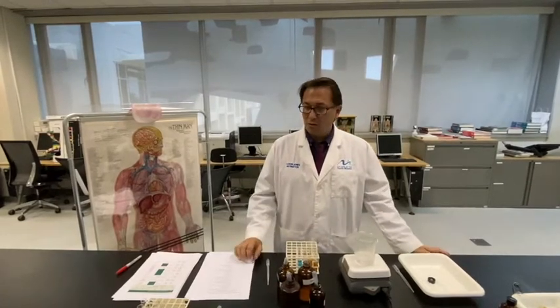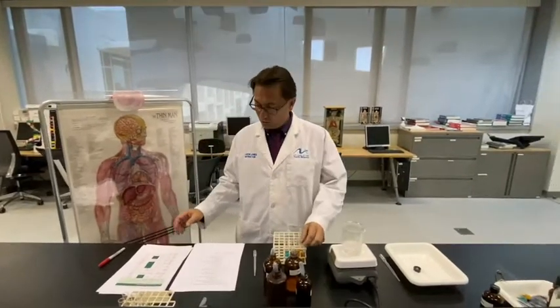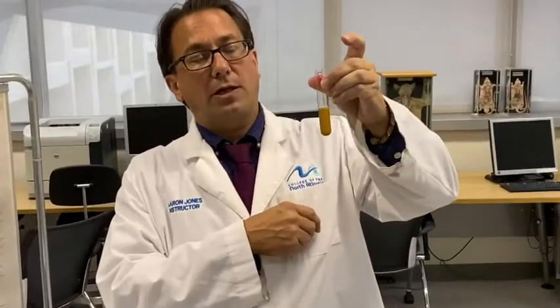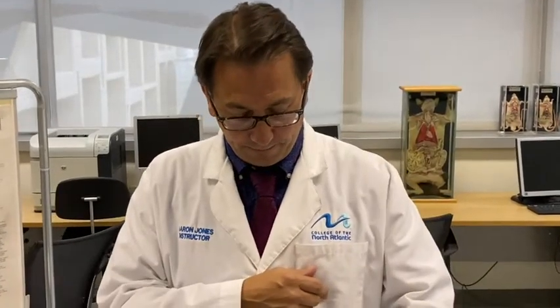Okay, so that concludes the procedures. The results, we'll just go through the results quickly one more time. Was there starch digestion in the first one? Test tube 5, indeed there was. You can say yes to that column.